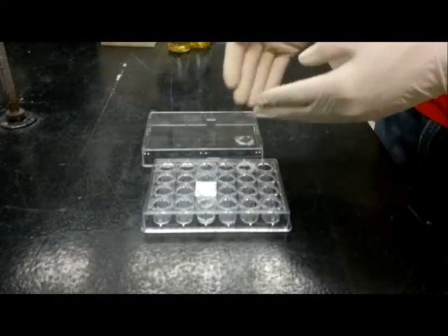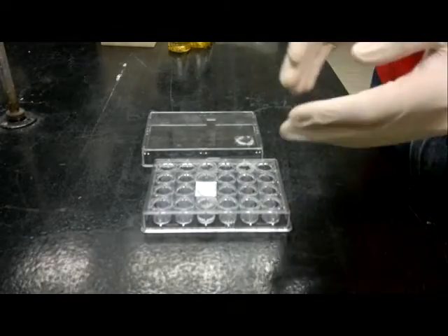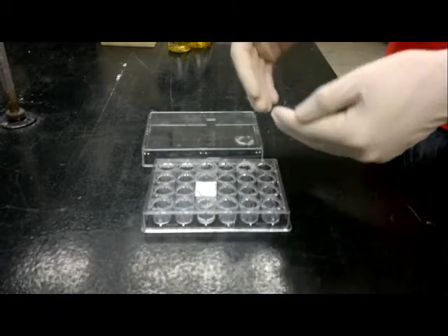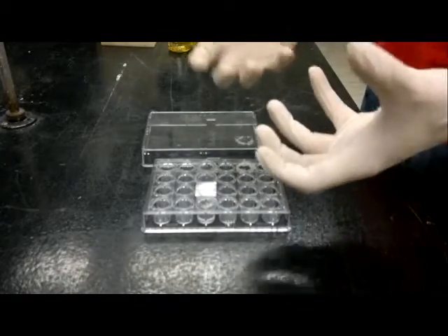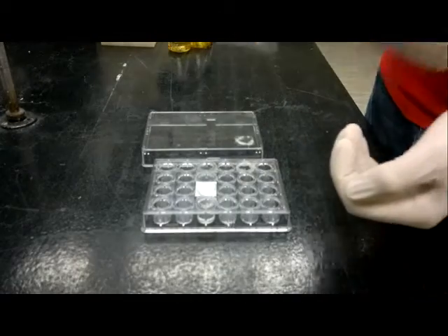At this point, you can add in the methylene blue. Now within, let's say about five to ten minutes, you should be able to notice that the protein crystal will begin to suck the methylene blue out of the solution and incorporate it into its structure.